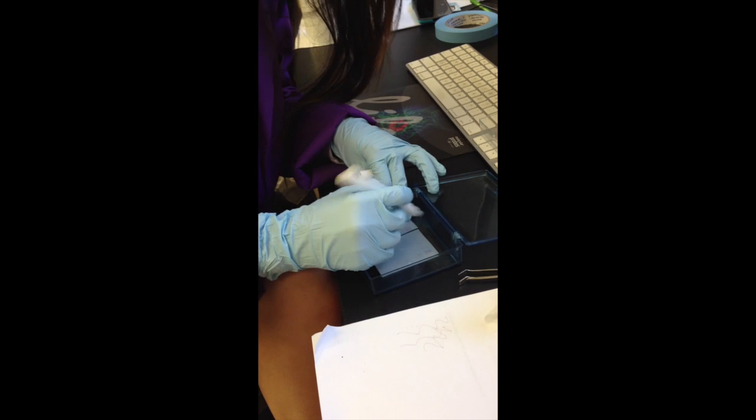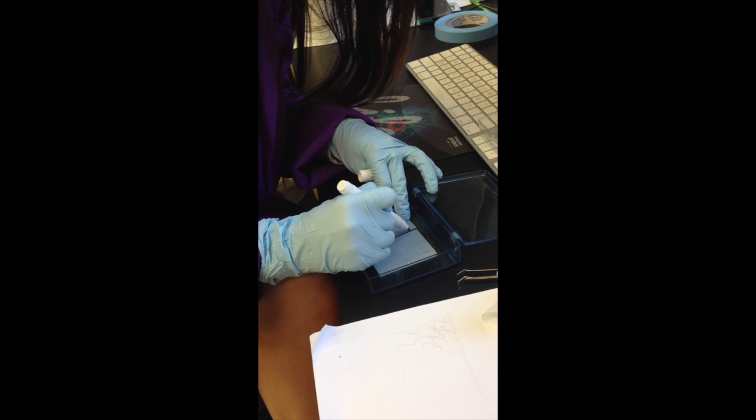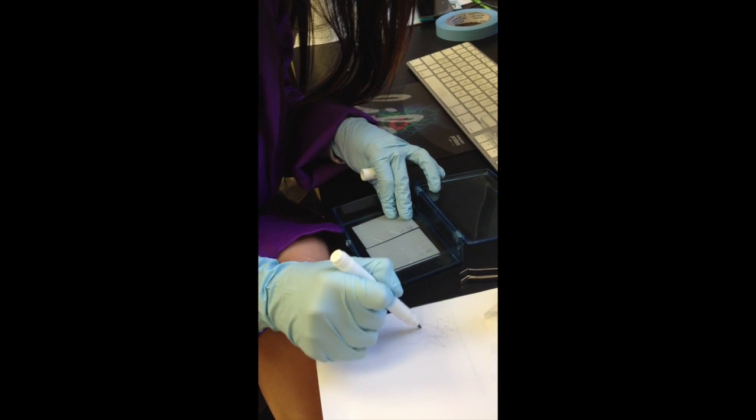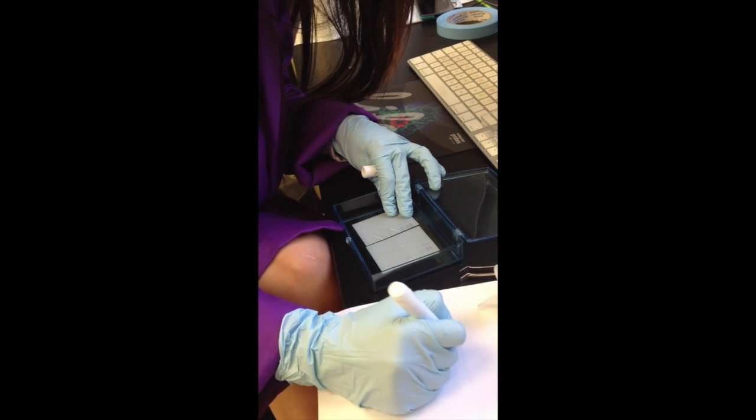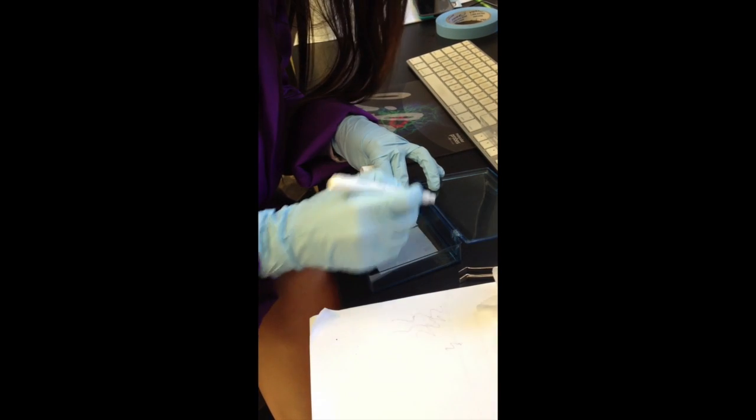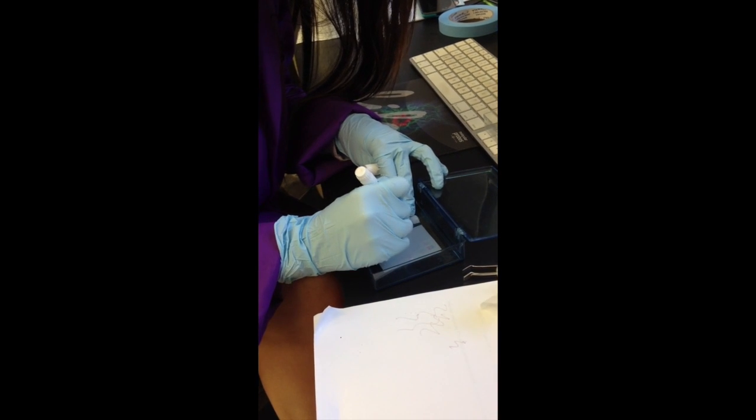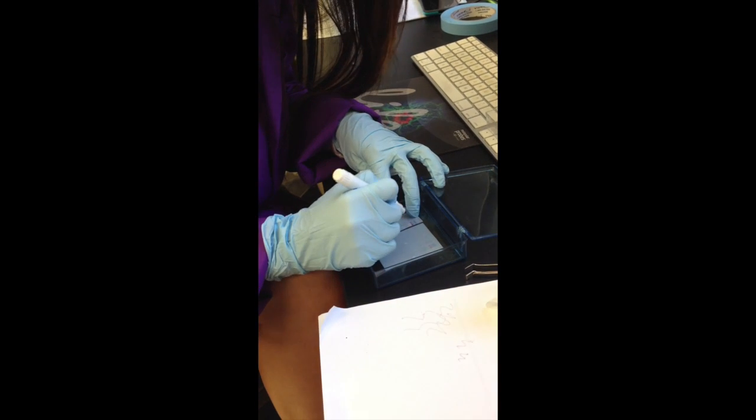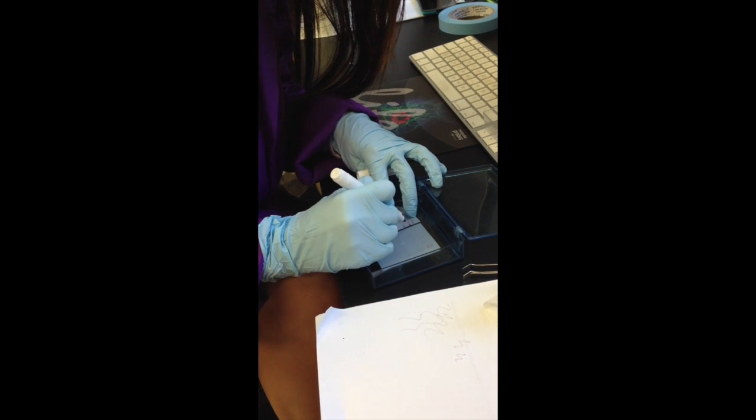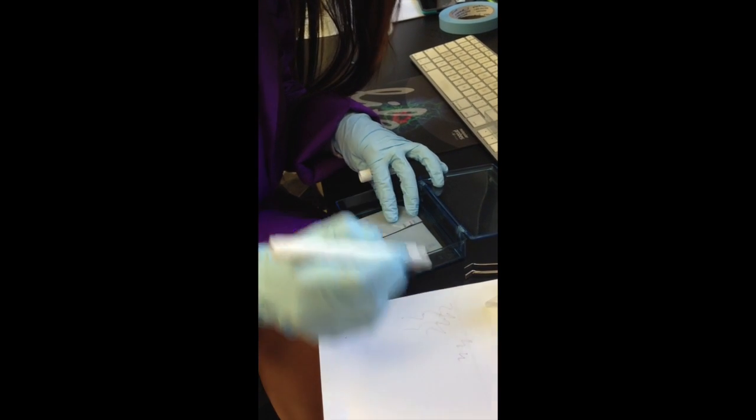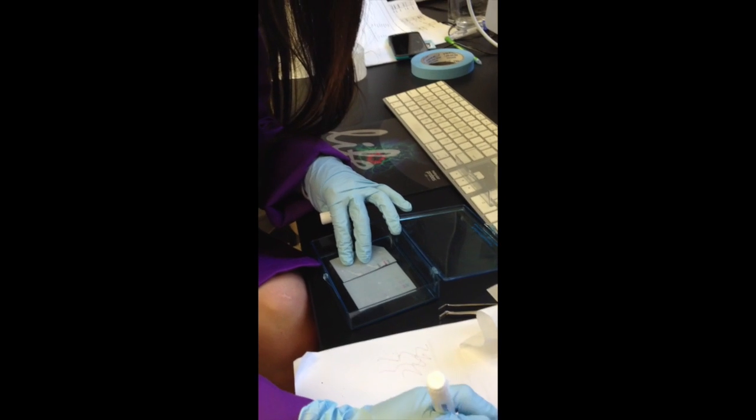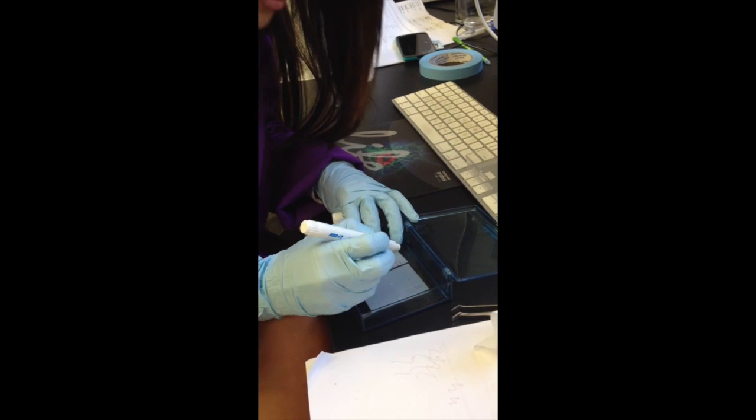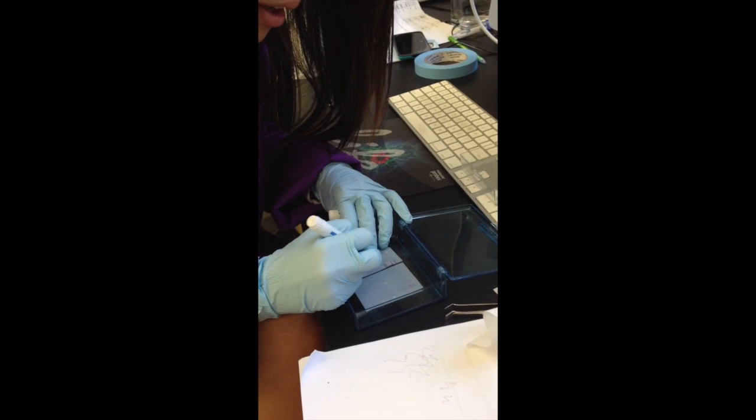And then you draw your bands on, but you have to test the ink in between each one to make sure that the ink is transferring to the paper.